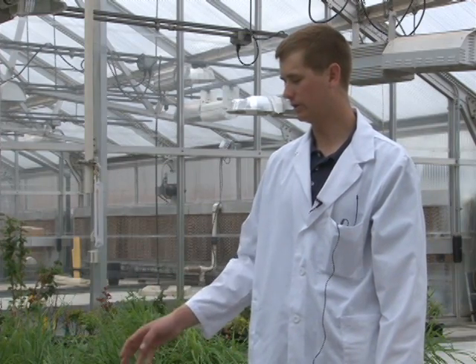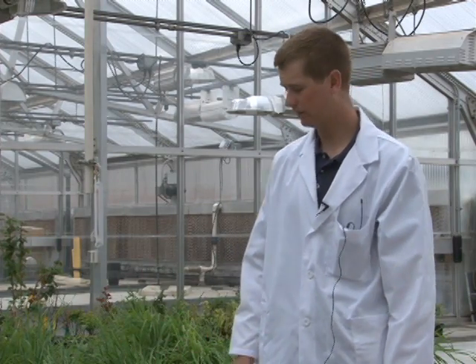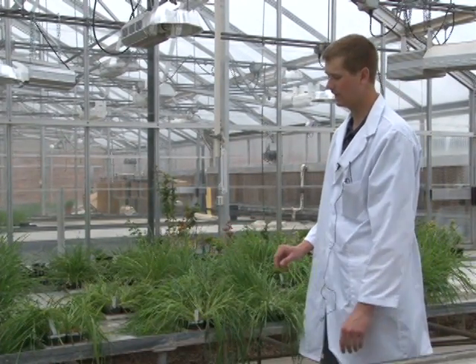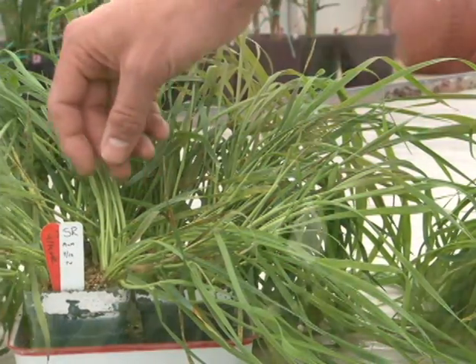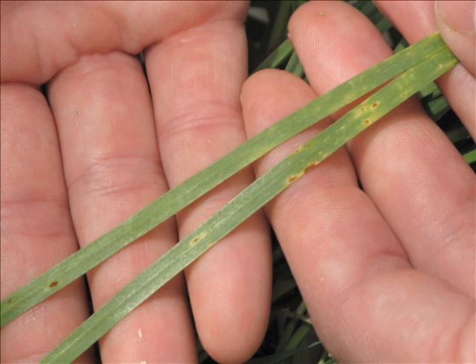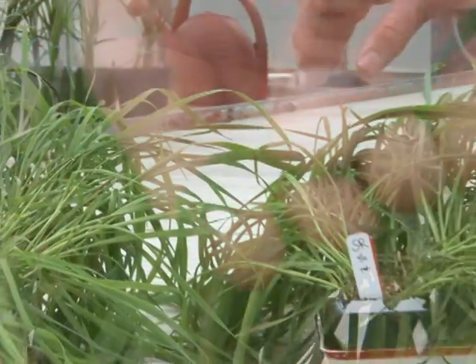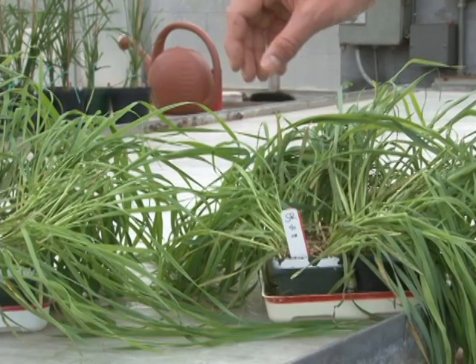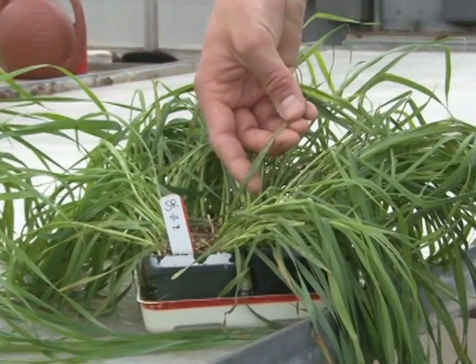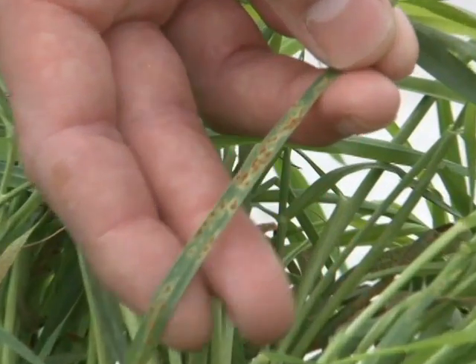As an example, I'd like to show you SR6. Here I have two trays of differentials that have both been inoculated with the same isolate of stem rust, TPMKC. In this tray, kept at 16 degrees Celsius, you can see a low infection type — fleck infection types and also one infection types. In contrast, this set of differentials was inoculated with the same race TPMKC but kept at 20 to 22 degrees Celsius.